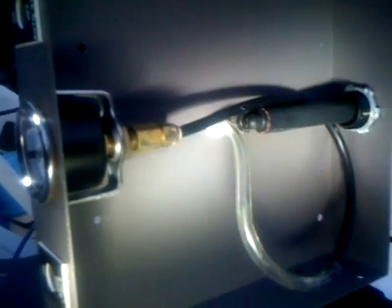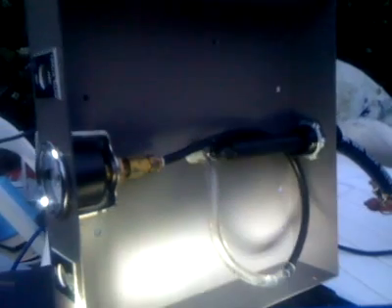Underneath here, just a couple of bits of pipe. So you can see the main black pipe going up the centre there comes from the compressor, and then the roundy tube comes from the vacuum gauge. The clear tube had just been salvaged from an oxygen purifier or something from the scrapyard, so it's all just scrappy bits put together.